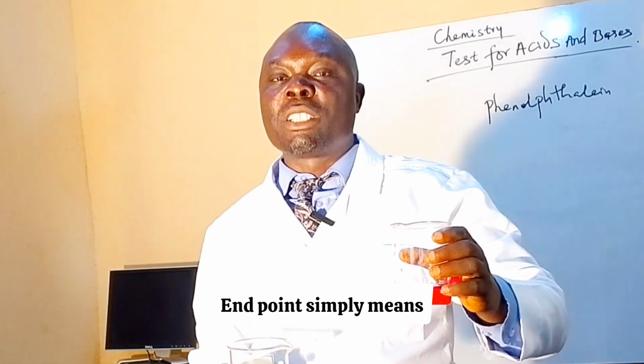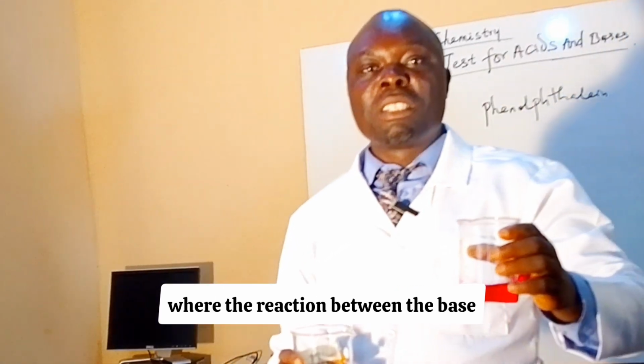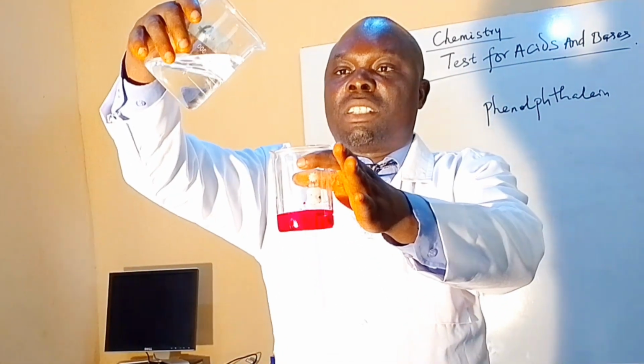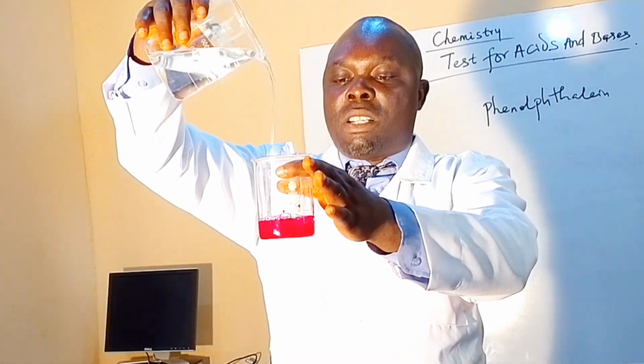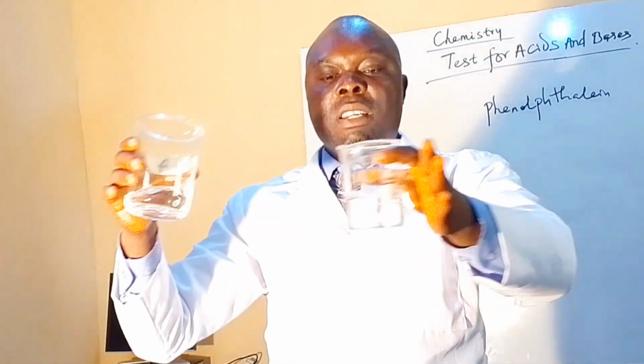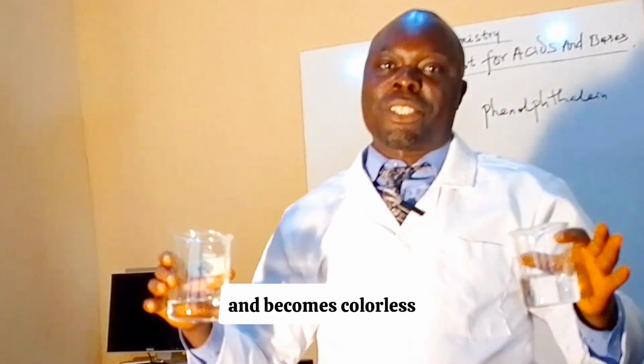End point simply means where the reaction between the base and the acid is complete. Watch. At the end point, the color disappears and becomes colorless.